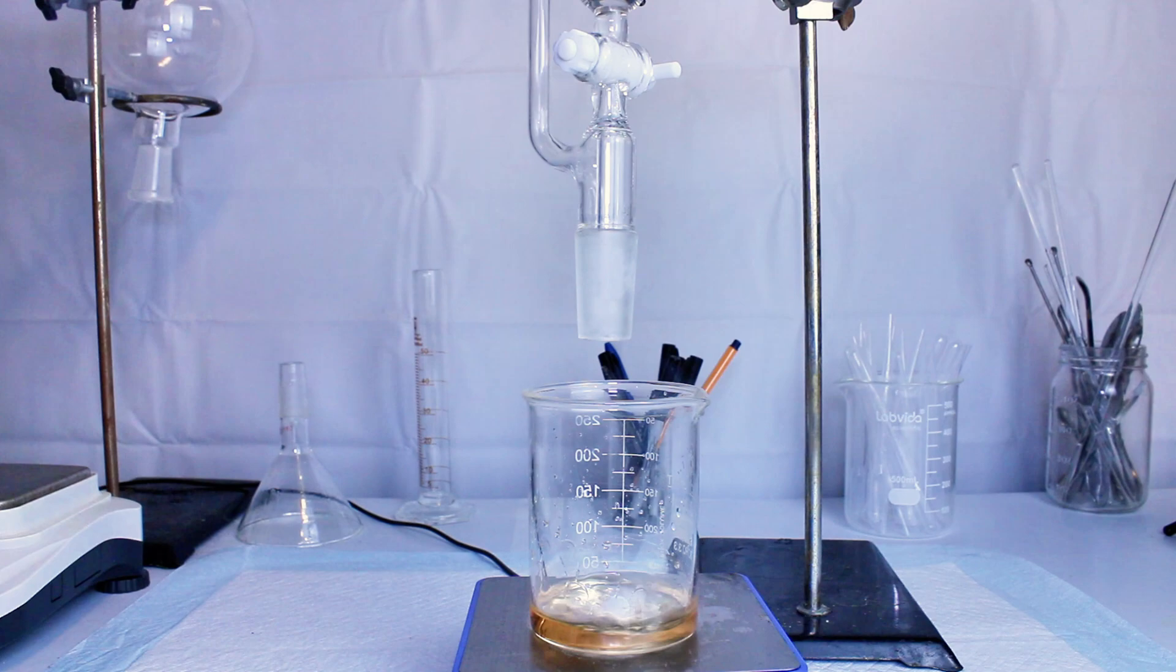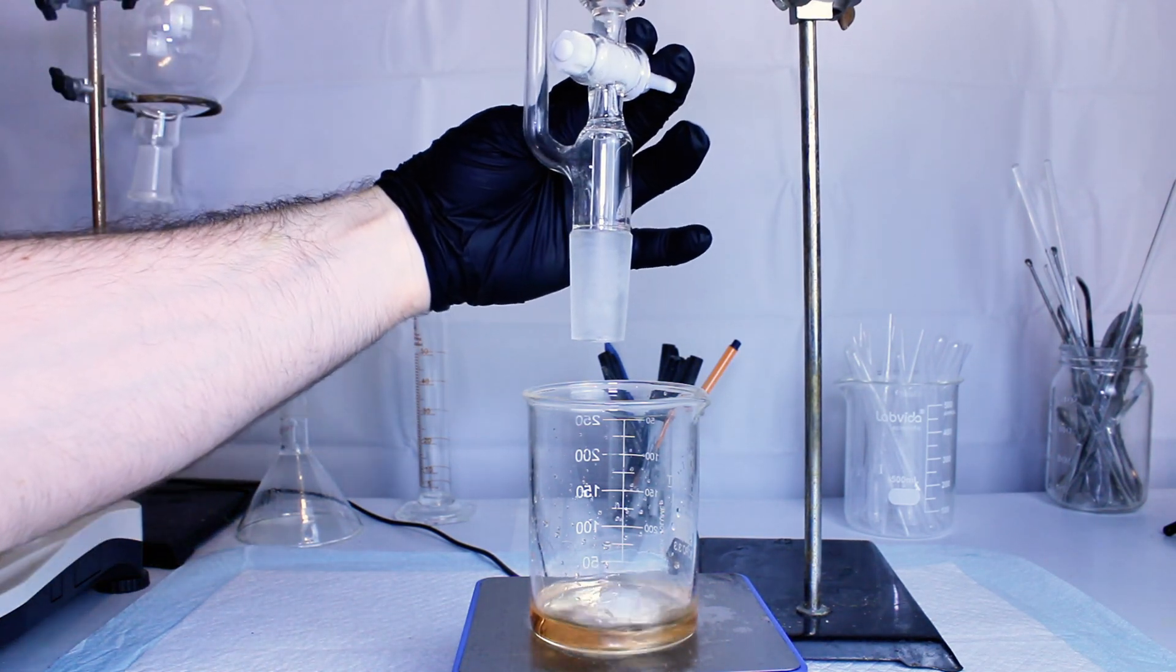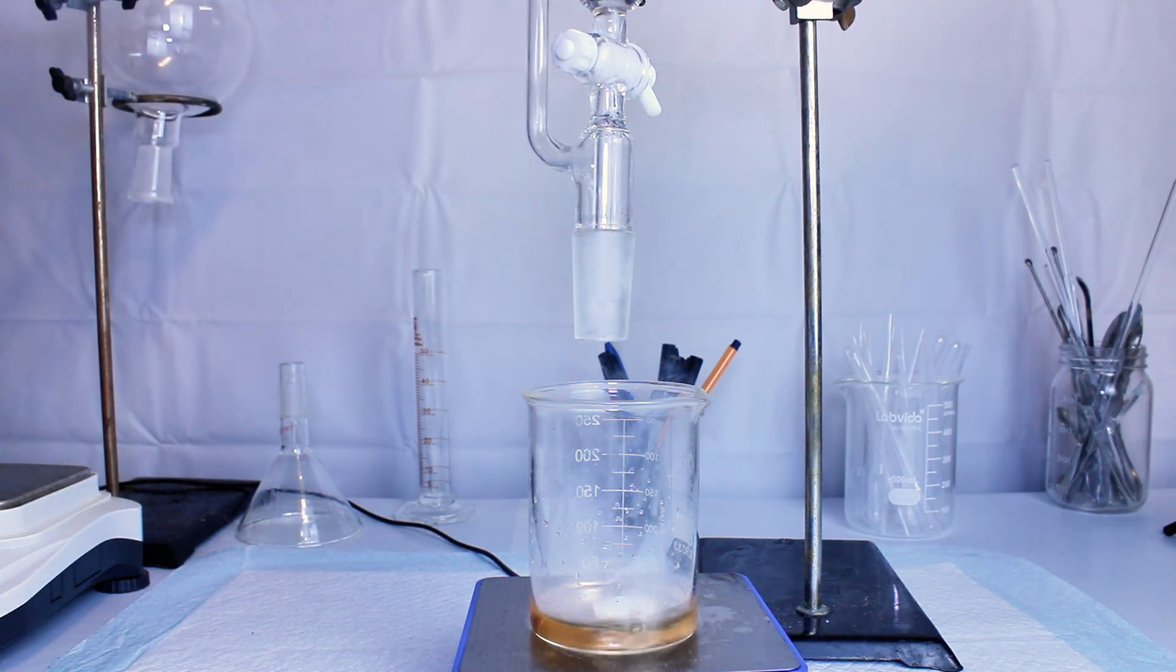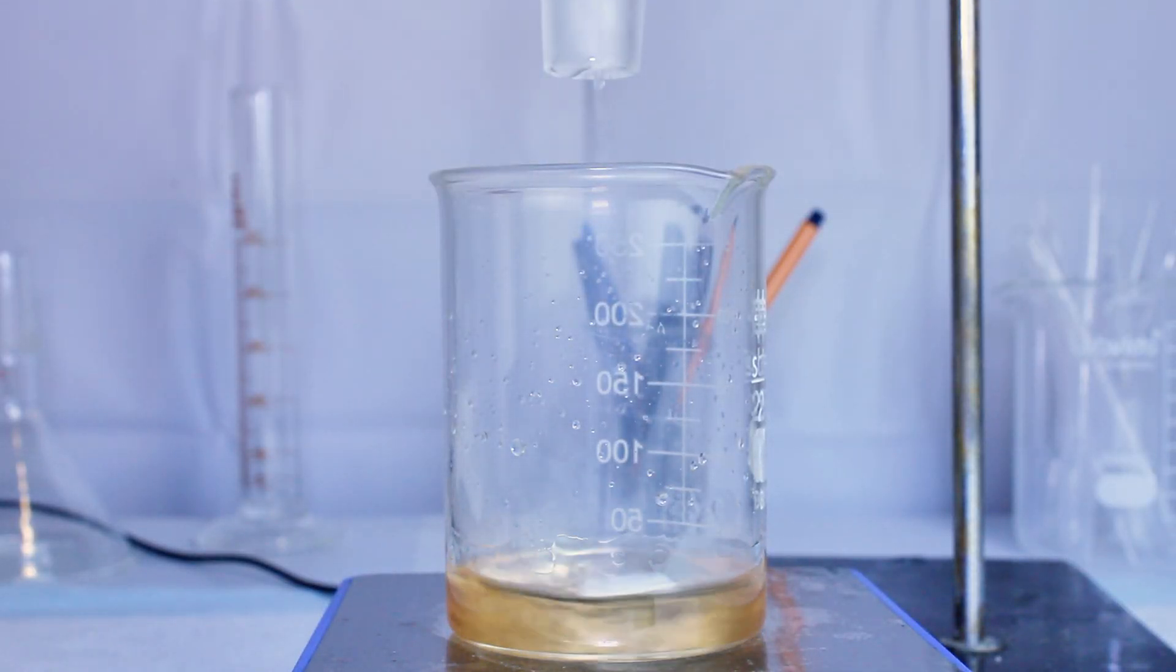This represents a slight excess of hydrochloric acid, which is done intentionally because any excess hydrochloric acid will simply boil away, while any excess aniline would contaminate the final product and be very difficult to remove.